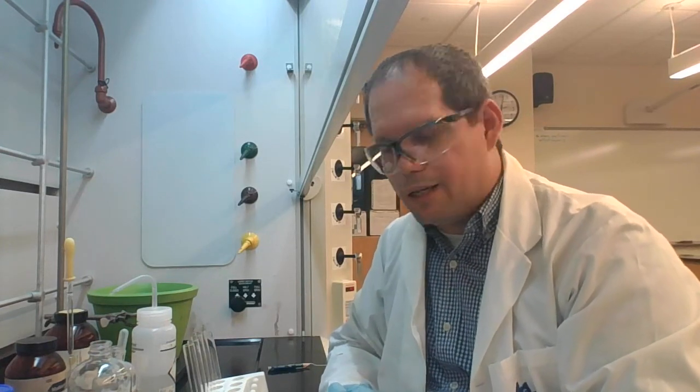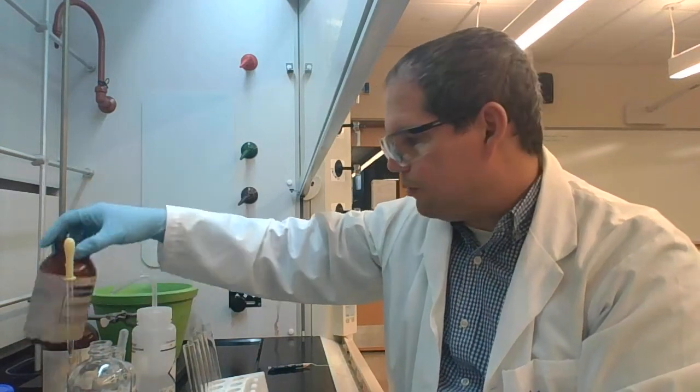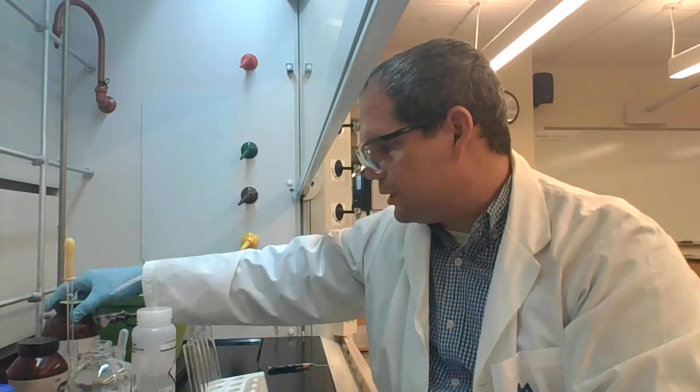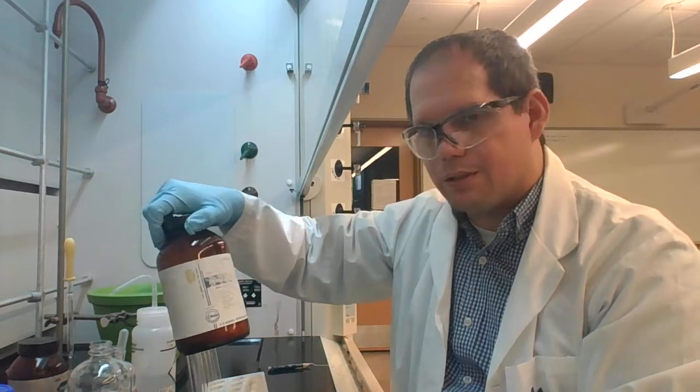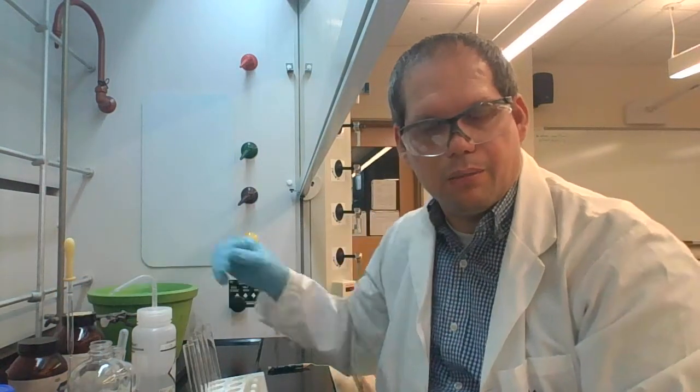So with test tubes 4 through 6, we're going to be looking at benzophenone, and then with the last 3 test tubes, we're going to be looking at succinic acid. It's essentially the same procedure. We want to mix each of these solids with the 3 different solvents and observe the results. So the results for these last few tests will be emailed to you by your lab instructor.